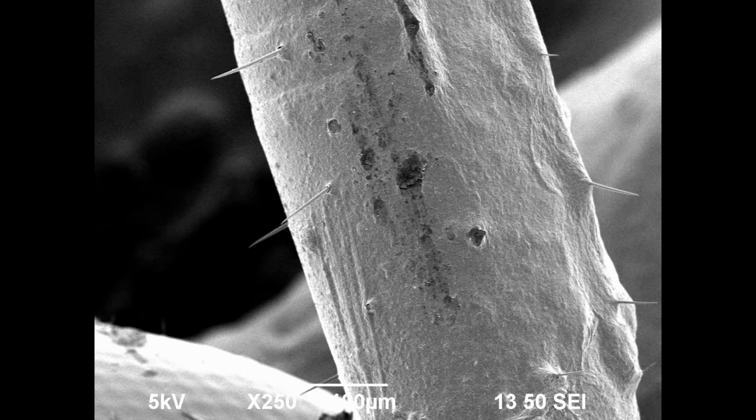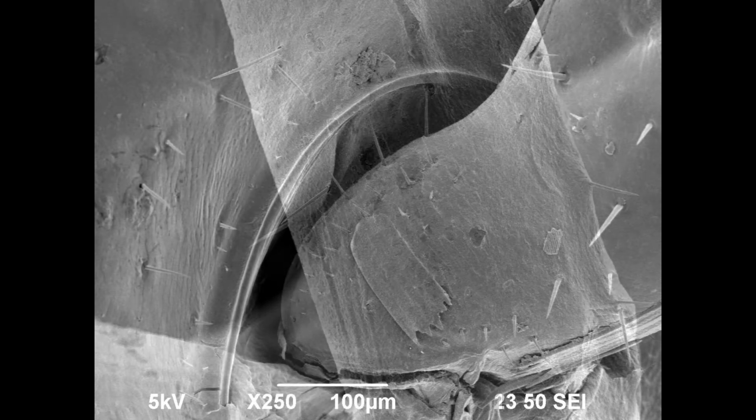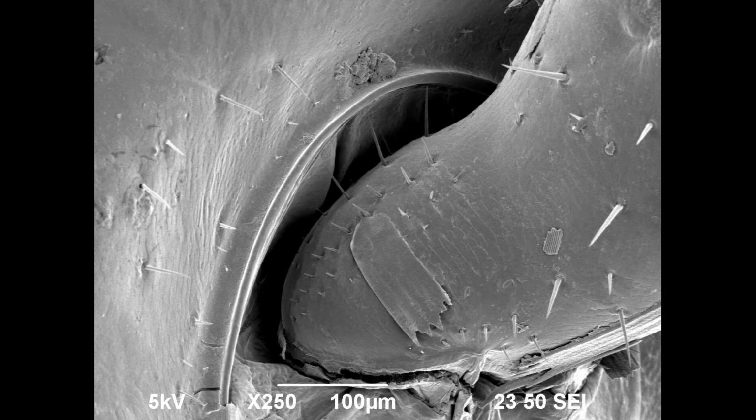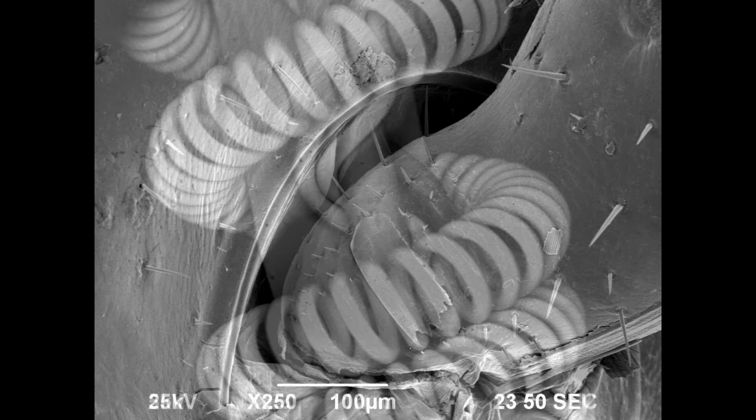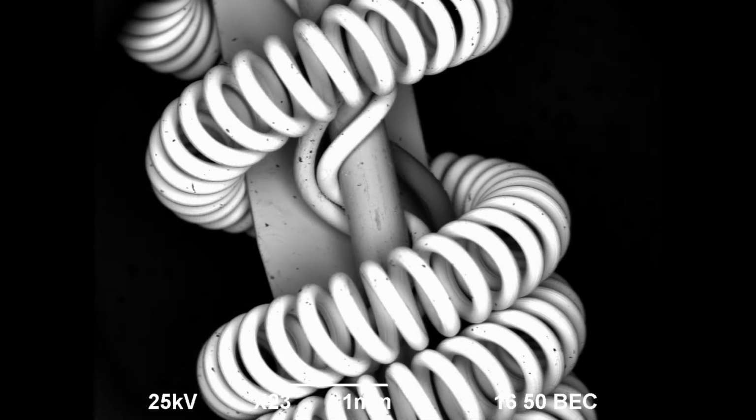Now on to SEMs. SEMs scan across the sample, hence their namesake. The SEM samples do not have to be thin, but they do have to be electrically conductive, and I'll explain why in a bit. SEMs start with the same electron squeezing into a beam that finds its smallest point on the surface of the sample as the TEM. That's where the similarities stop, though, as the SEM creates an image by moving the beam across the sample in a rastering pattern, meaning it will move the same way monitors and TVs draw their pixels, one at a time, starting from the top left corner, moving to the top right corner, then down a row and repeat the left to right motion. The SEM uses this pattern to make an image.